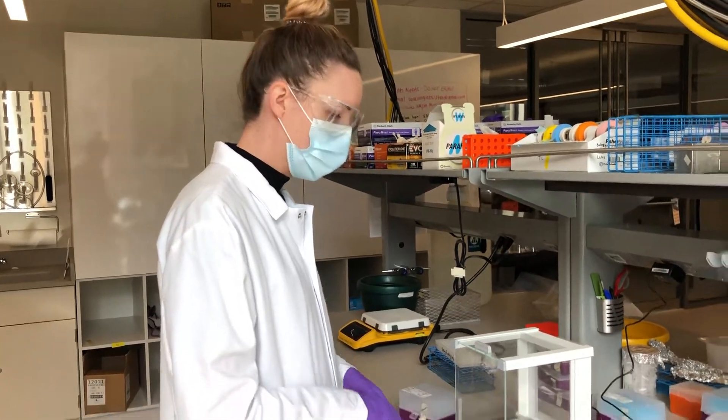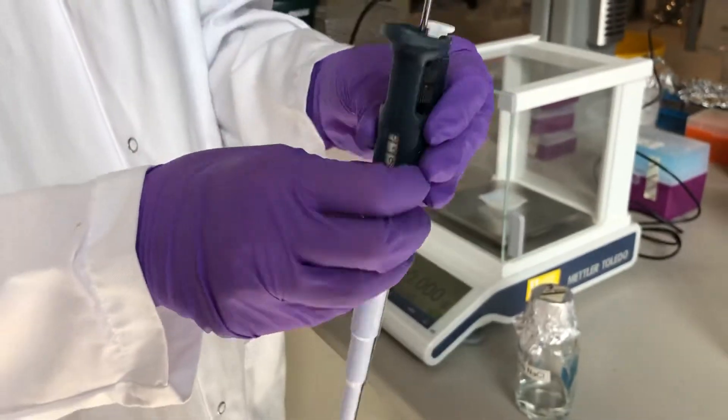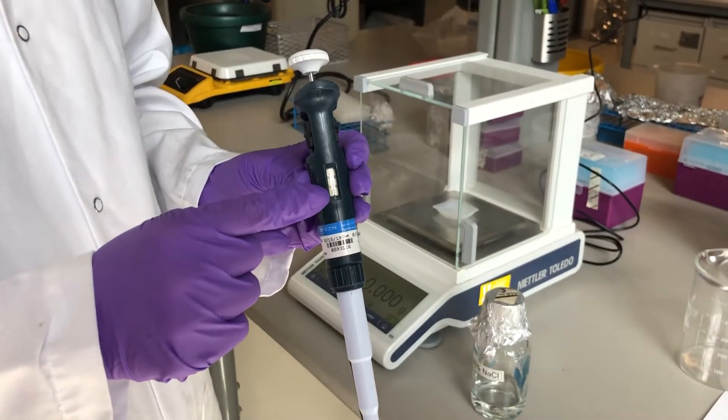All right, so I'm going to be doing the P1000 measurement and I'm going to be doing 500 microliters.